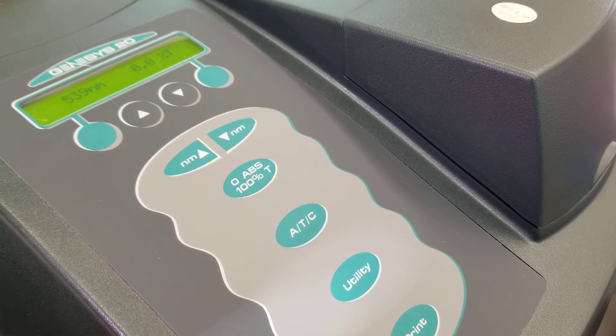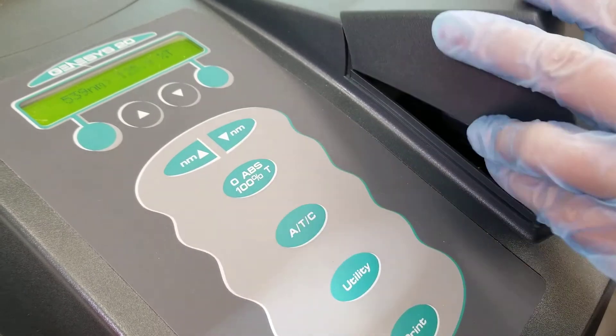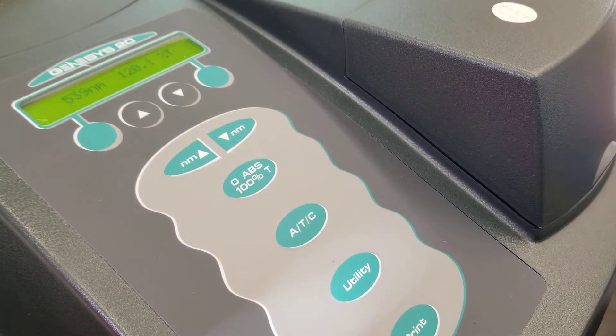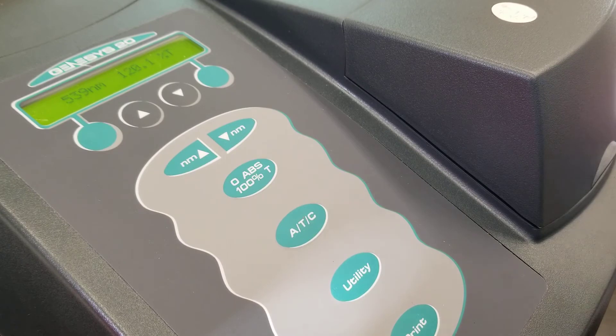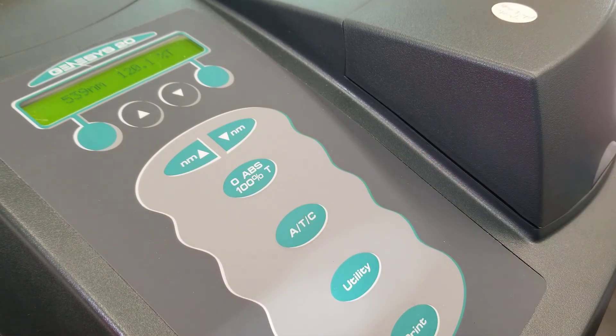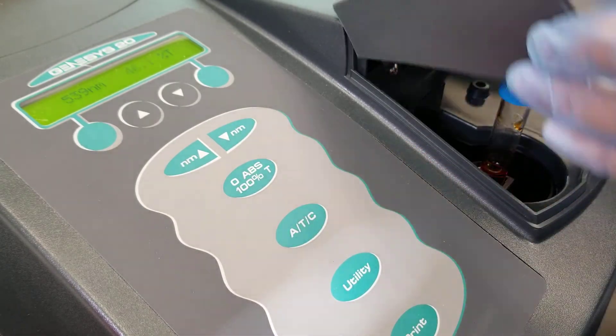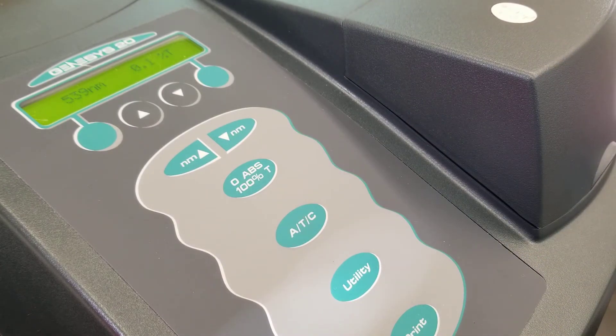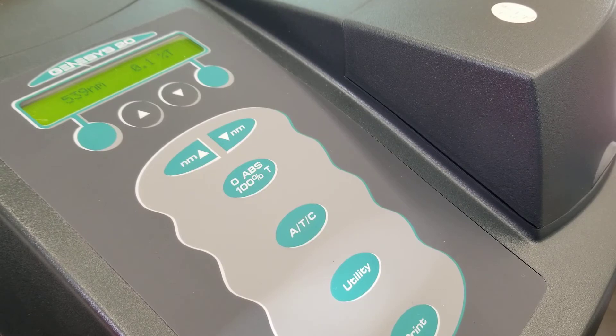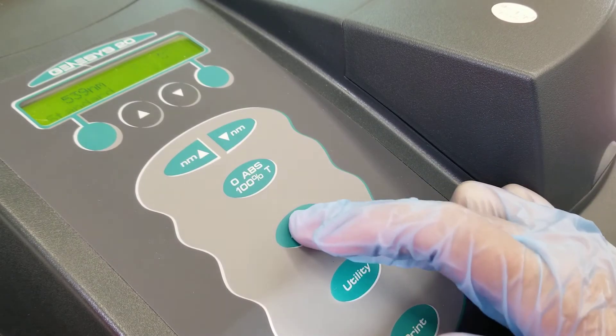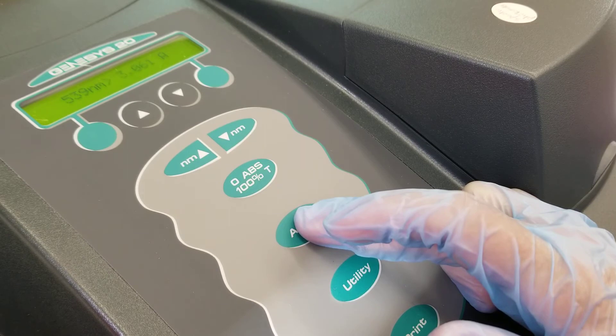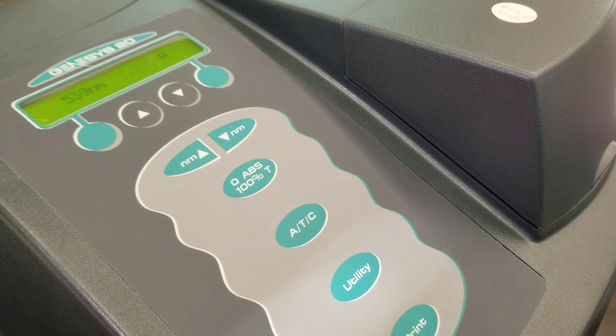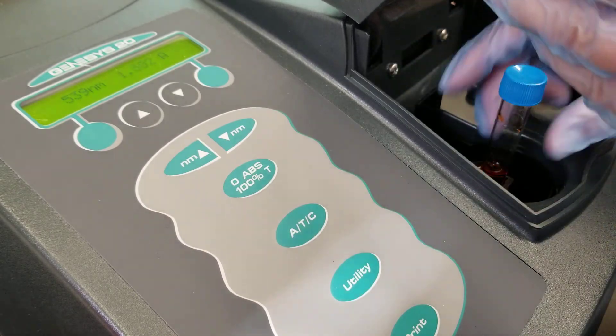So, hey, there was another class period that we've talked about. All right, let's try a different one. Let's try something a little lighter. We have some orange here. Let's check that out. So we have a little bit of transmittance here. Let's see absorption. That's pretty high.